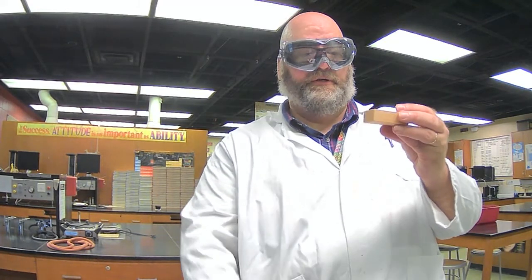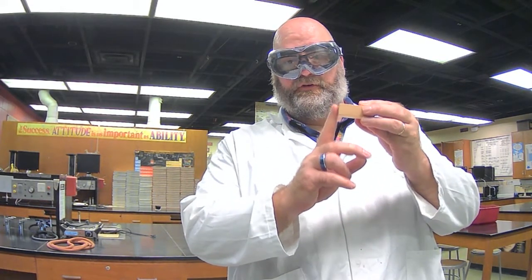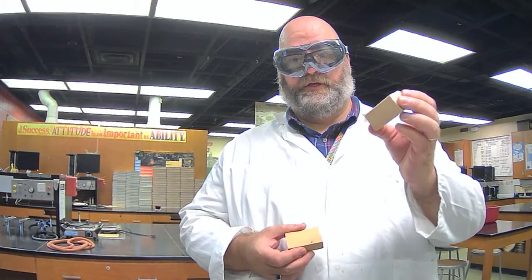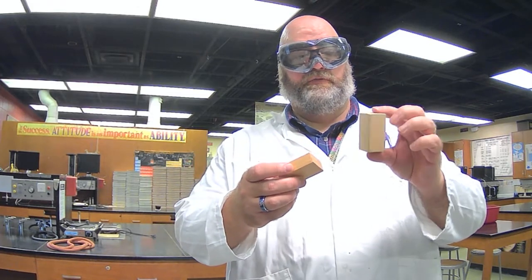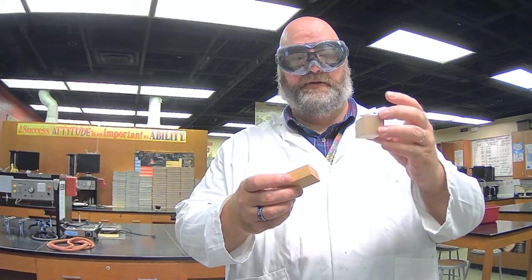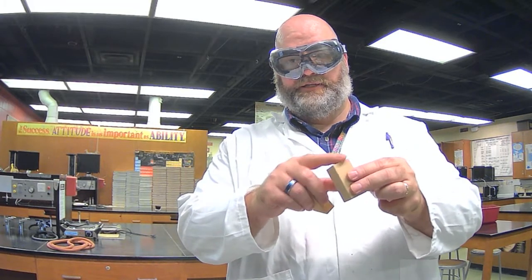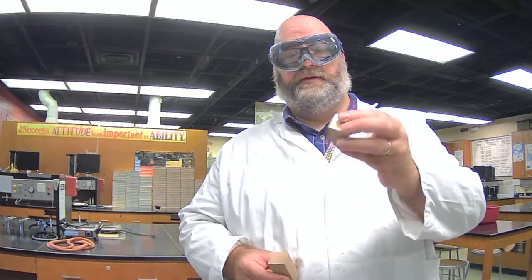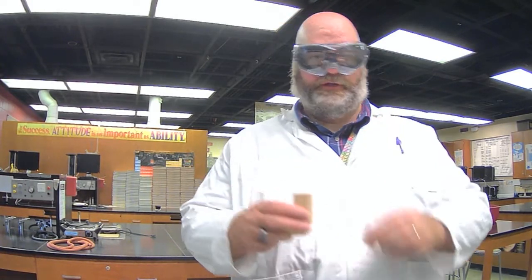So I place my first wooden block on. Wooden block number one is 19.32 grams. It's a short height block, but wide. The difference between a more cylinder-like shape, a square base but tall, and then basically a cube. Those are the three that we're going to do.